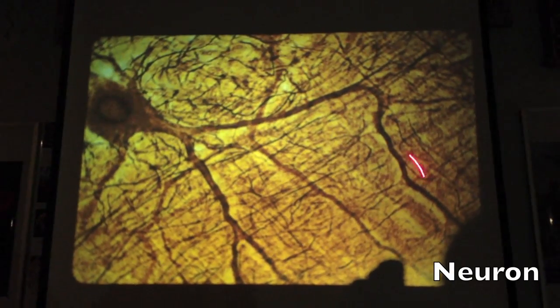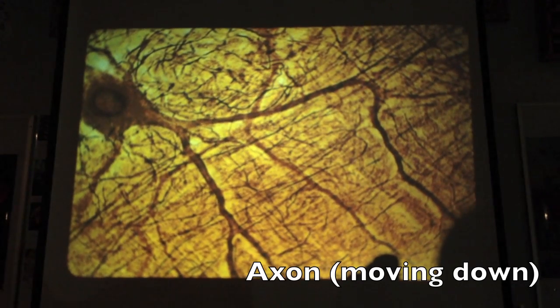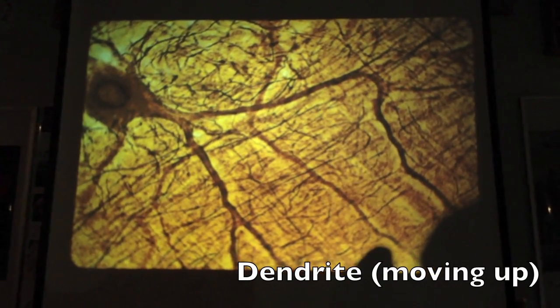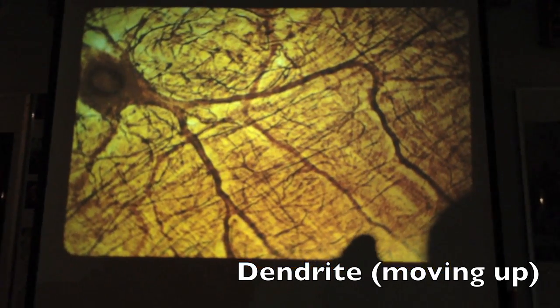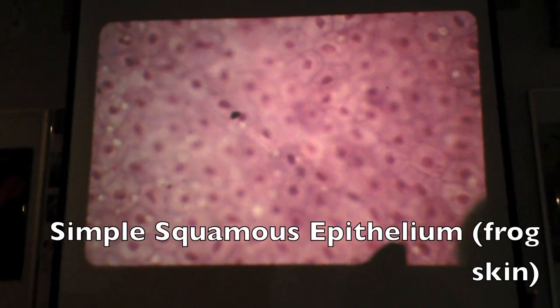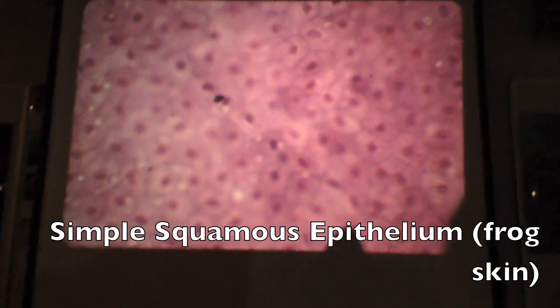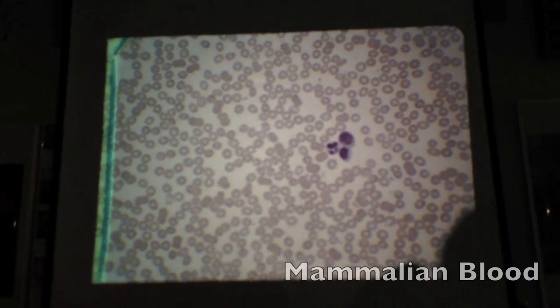What's this? Neuron. And if the impulse moves this way, what's this fiber called? Axon. And if it moves this way, then it's called a dendrite. This is frog skin, so this is one I had a demonstration back there. So again, simple squamous epithelium, viewed from a perspective where you can actually see it.